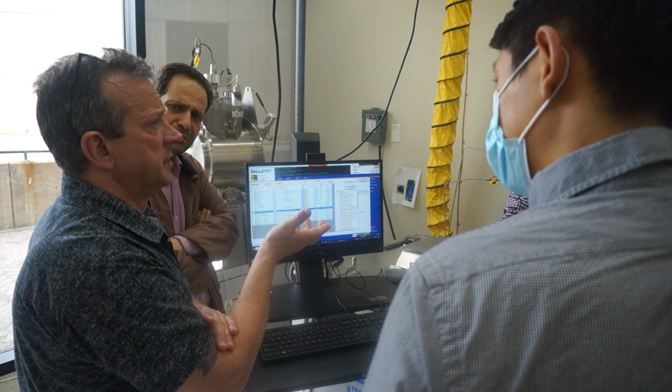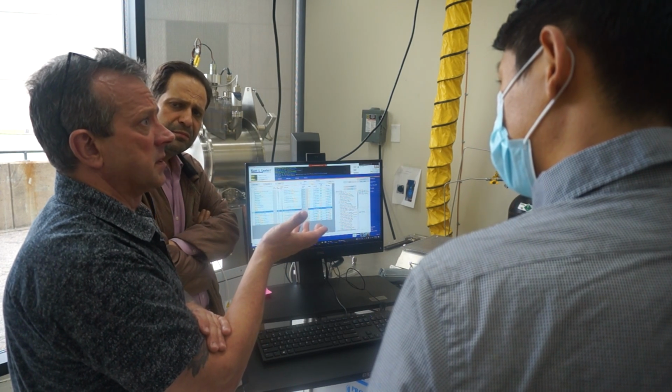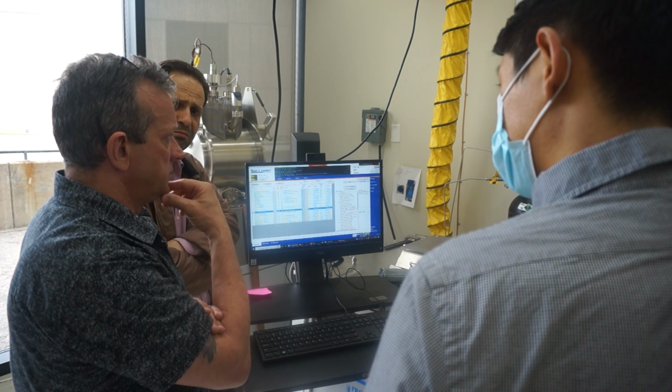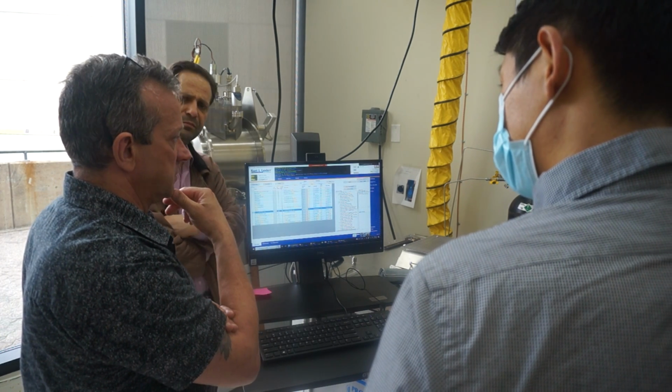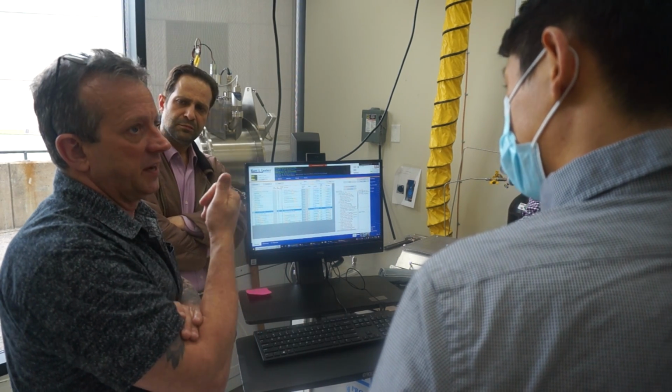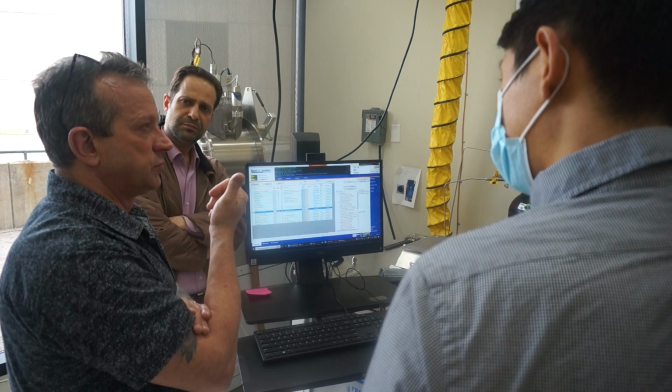The stuff is like depositing bubble gum, it sticks to everything. It's real soft and horrible to clean up. For that reason, I wouldn't do it in the ALD system. You could do it in that system and then foil everything up, because it creeps, it's really weird.